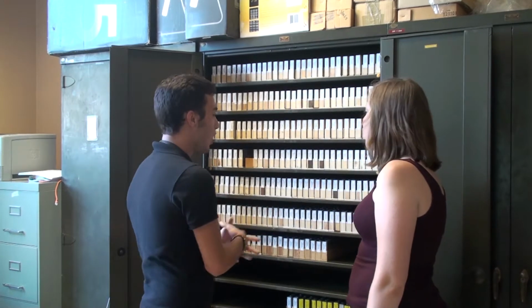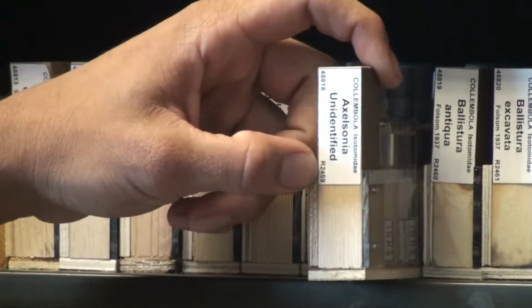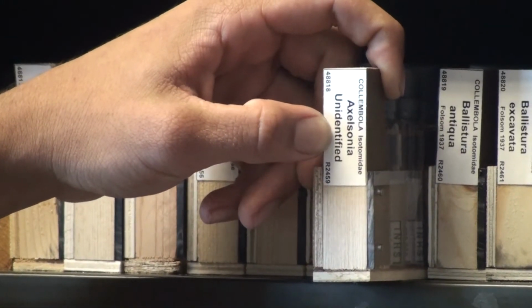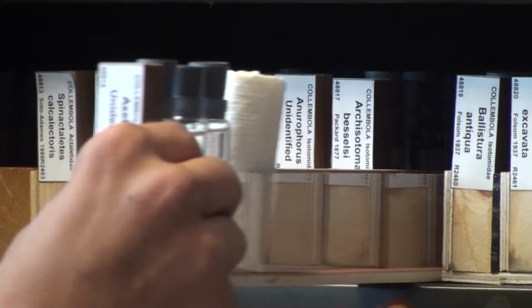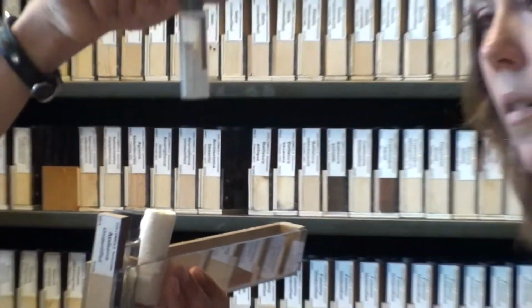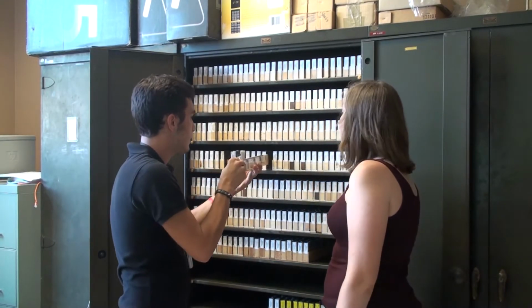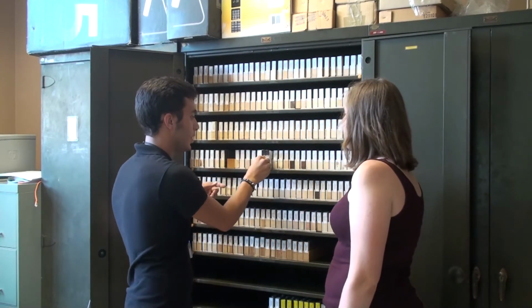Well, Christina, all of our vials are stored in vial racks. Each rack is labeled with a rack number as well as the lowest taxonomic identification. Within each rack, the specimens are organized numerically according to the UID labels. You can see that each one of those numbers is unique to that specimen in our database and allows that specimen to be tracked back to its location in the collection.